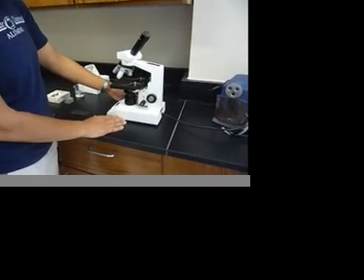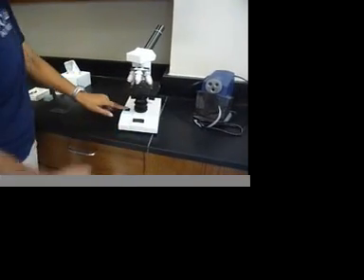Once the microscope is plugged in, you want to turn it on. There's an on switch on this particular brand of microscope.